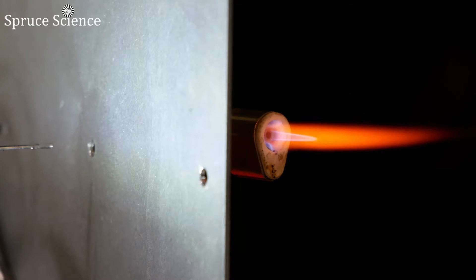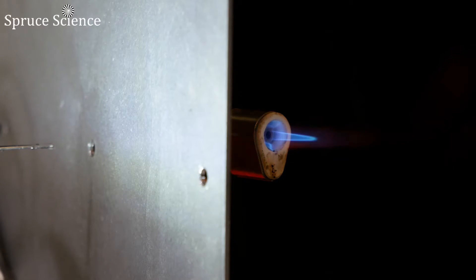In this demonstration, high voltage is applied directly to sodium solution to generate tiny sodium droplets. These charged ions are then brought into a gas flame so that you can see the bright yellow light emission.